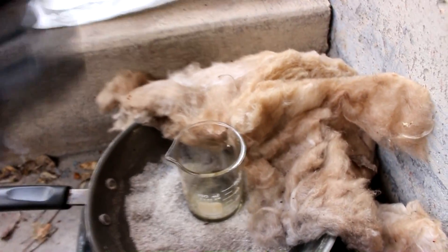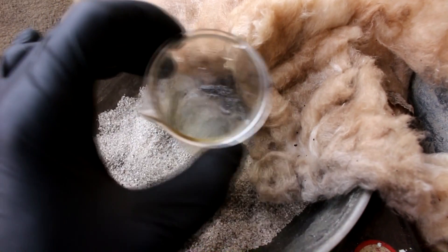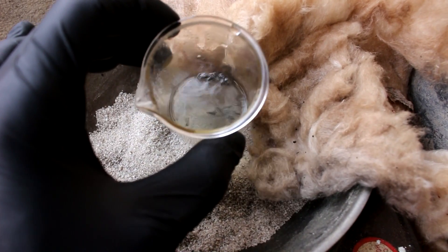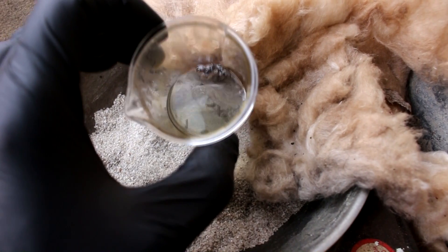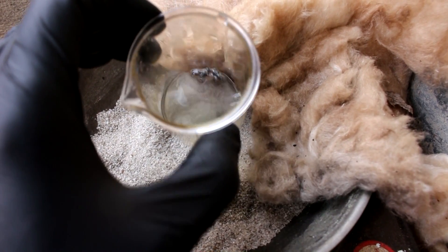Just pull that up, set that over there. So yeah, there's still some pieces left. I eventually took my knife and actually cut the thallium into little chunks and that made it dissolve quite a bit faster.